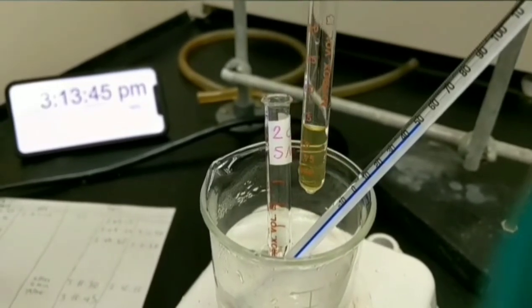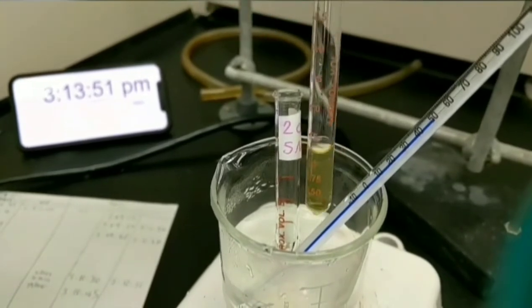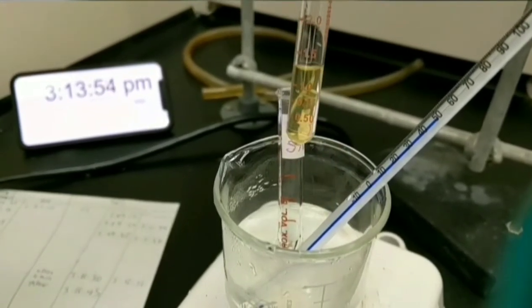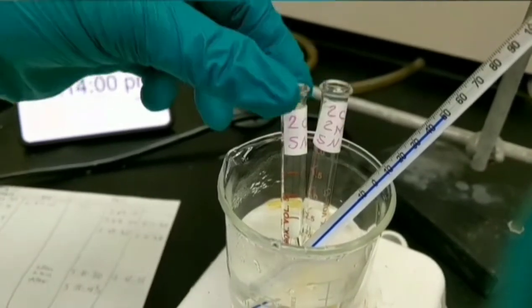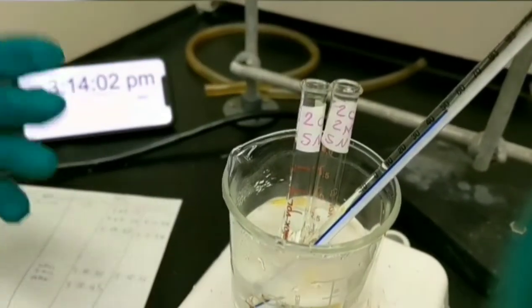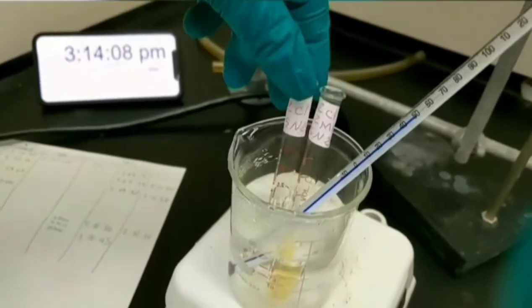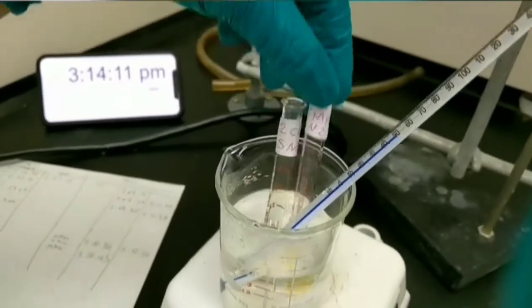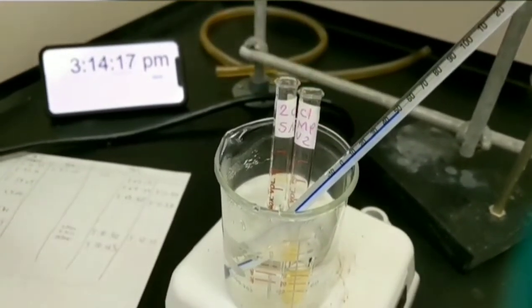This substrate also is a tertiary alkyl halide, so it also shows a positive error. This positive error shows that another kind of reaction happens here which caused this precipitation. And this positive error is related to elimination reactions.